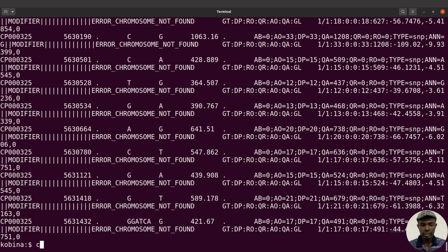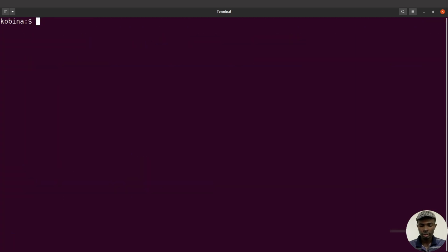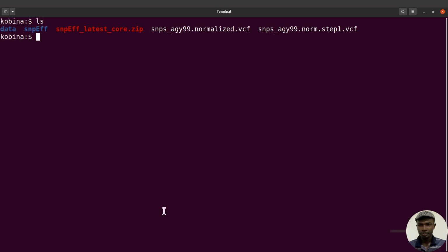So before we resolve, let's just clear the screen. Let's do an ls, and then you are likely to see that no file or no output will be generated. That's fine. Okay, we had some errors. So we are going to resolve the error that we got, that is, the error chromosome not found.